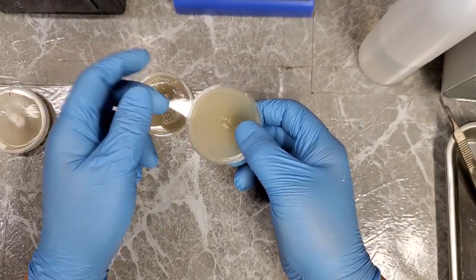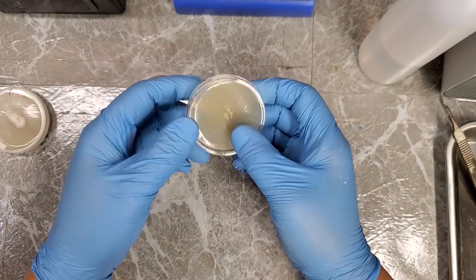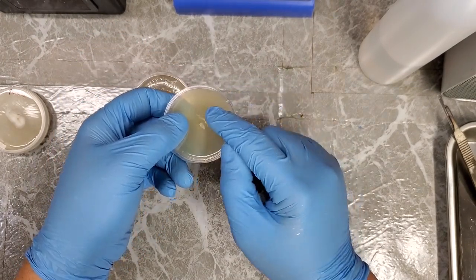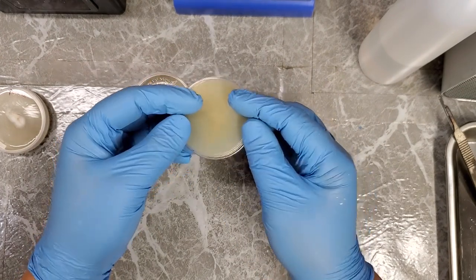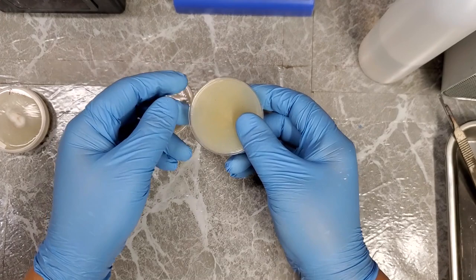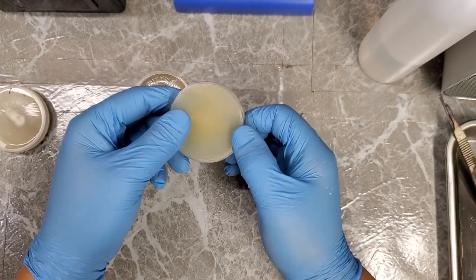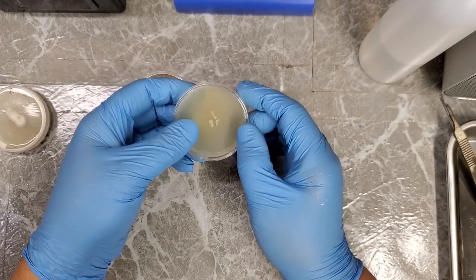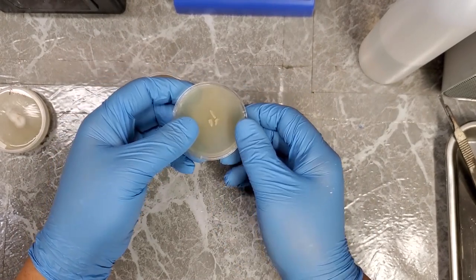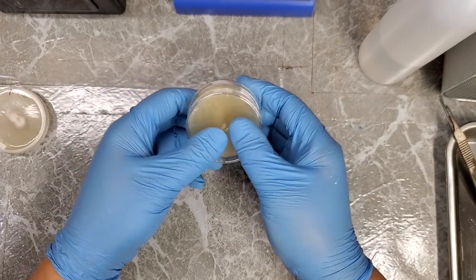Usually, you're fine by just inverting these straight from the cloning process like this. But once in a while, you'll run into the issue where the sample that you put onto the agar, while it's freshly on there, if it's inverted, sometimes it'll just dislodge itself from the surface of the agar and fall off. And that's just completely negating any work that you just did. So yeah, that's why I like to let these grow for a few days before I wrap them and then invert them. But yeah, let's move these off to the side.